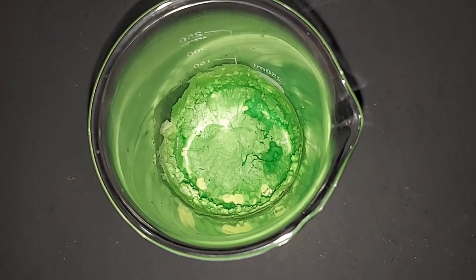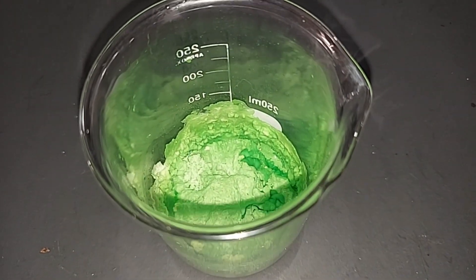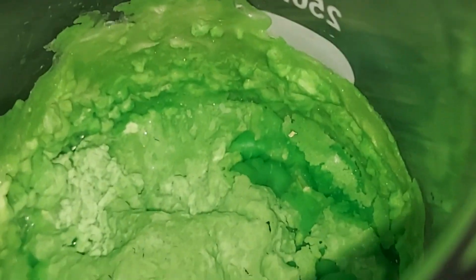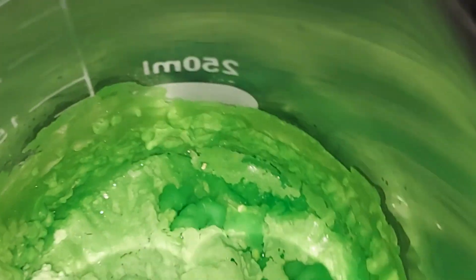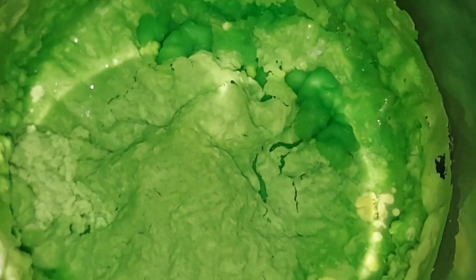When I first took this out of the fridge, I really couldn't tell what was going on at the bottom of the beaker here. But if I go at an angle here, you can see that it's anything but flat. And if I can zoom in here, you can see that a lot of crystals have formed here of nickel chloride all the way around. It's also peeling away from the edges, which tells me that it's very dry.